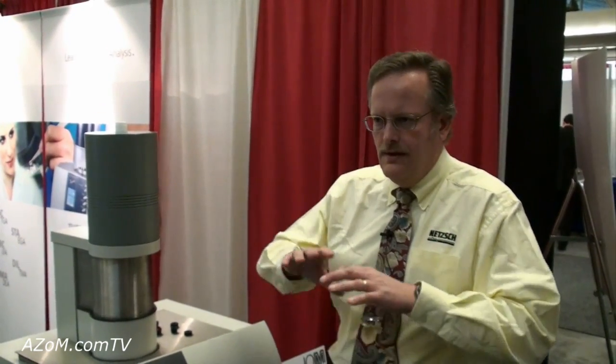That's the portfolio of laser flash instruments that we have. It's probably one of our most popular instruments now worldwide, and I think Netzsch is regarded as maybe the premier supplier of laser flash instruments in the world.